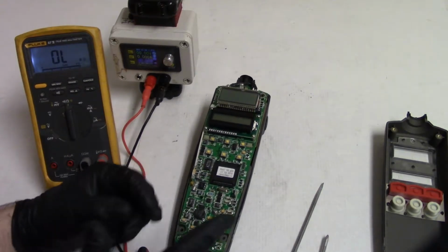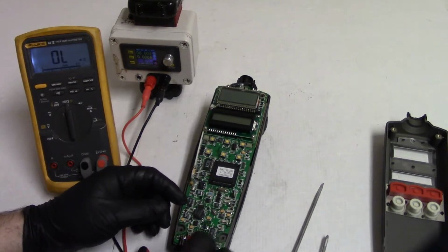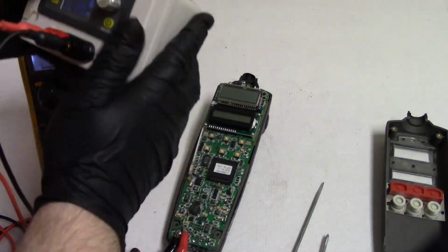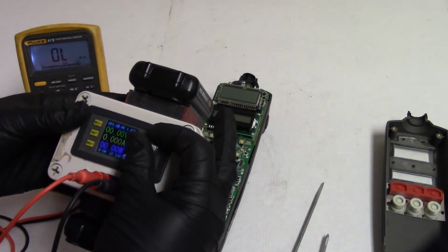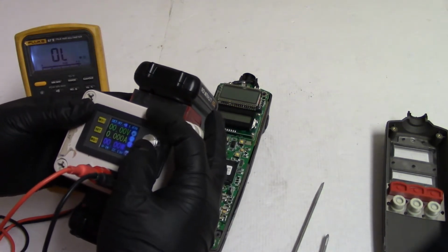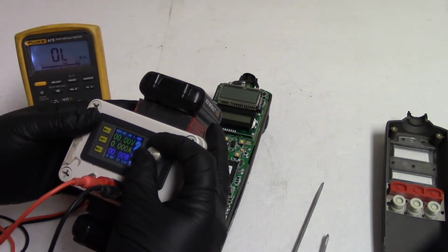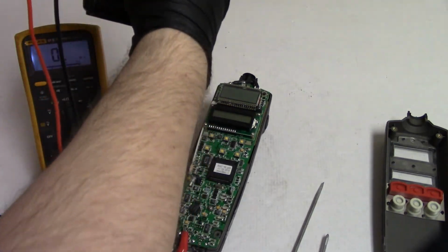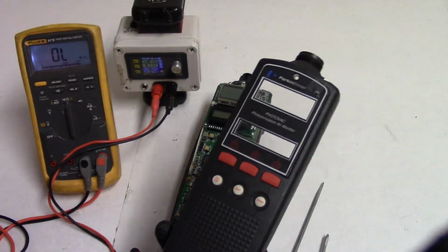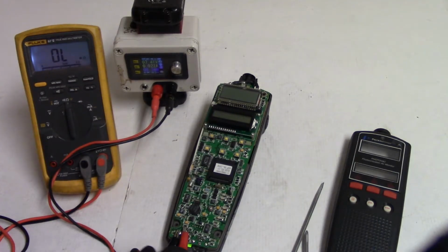So let's get on the ground. And let's get on the power. Let me just make sure that's safe. And then let's set our voltage. Let's go to 7.4. And we'll do about 1.5 amps. Alright. There we go. It's got power to it. So let's hit the on button. There it goes.